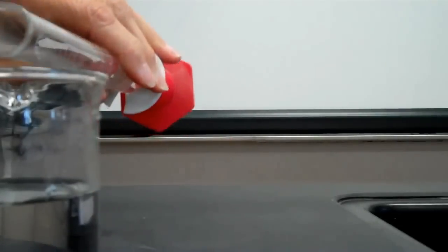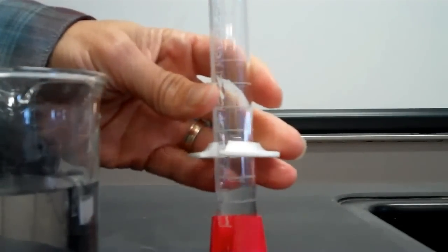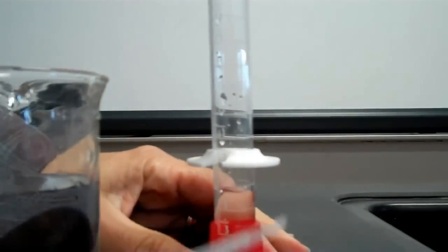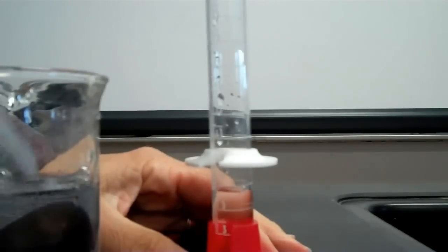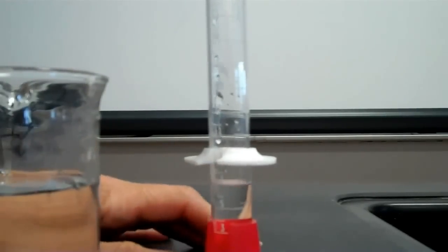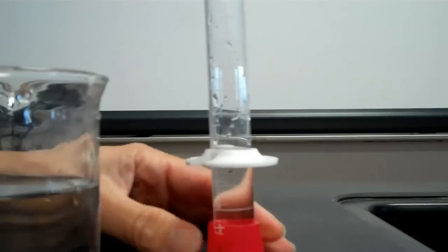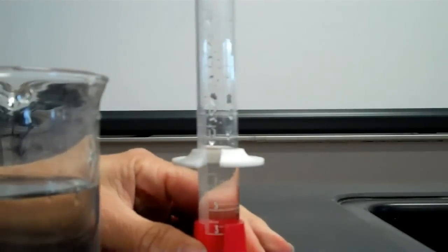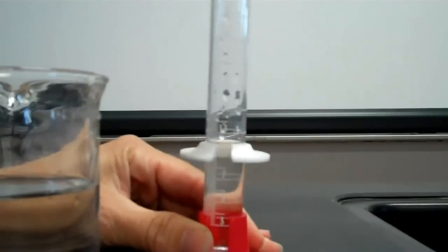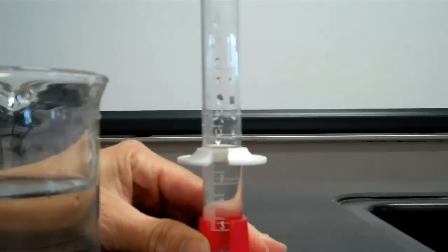So I'm going to pour some of that out. Now I poured too much. So at this point it's best to use the pipette and fill it up to 10. And look at it from the side. This is a good angle to see. It's about at 10.